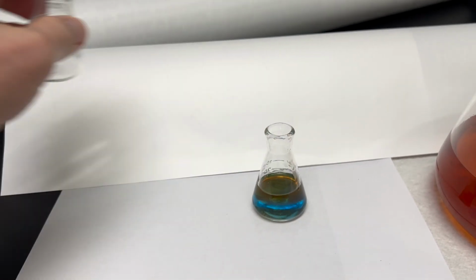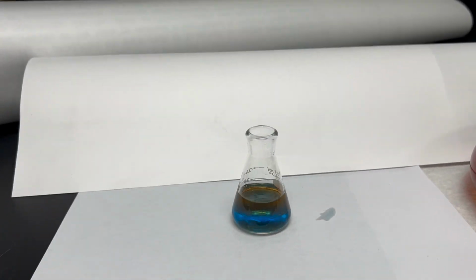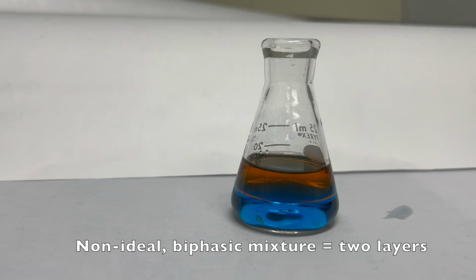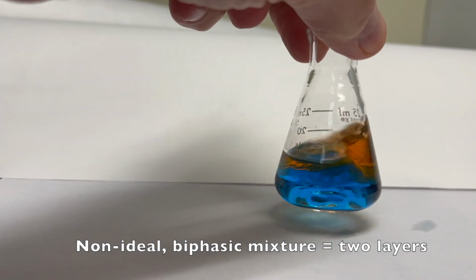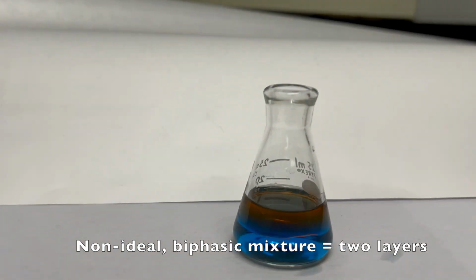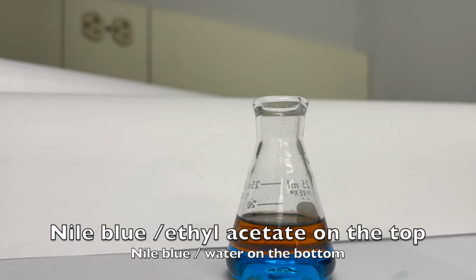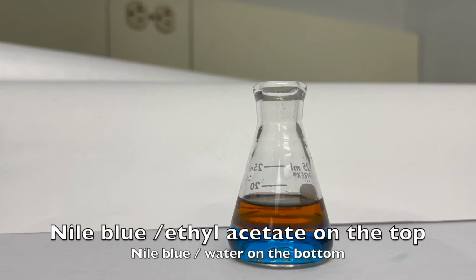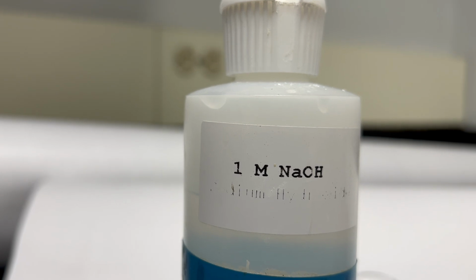So we form a non-ideal biphasic mixture. We get two layers, right? The denser layer goes to the bottom, the less dense layer stays on the top. Nile blue stays in solution in both, but the ethyl acetate solution goes to the top and the aqueous solution goes to the bottom. Now let's add some base, some aqueous sodium hydroxide.